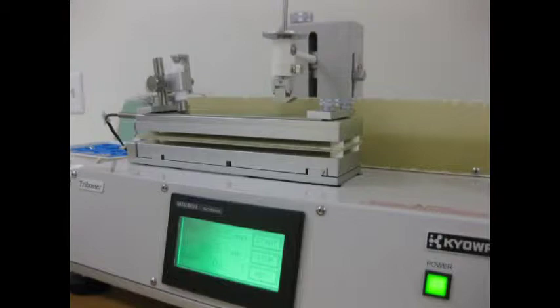The unit features a translating stage controlled by the software in the x-axis for making measurements, and it also has manual translation in the y direction to offset the sample so that each test can be done in fresh sample areas. Here we see the balance head mounted on the end of the measurement arm.